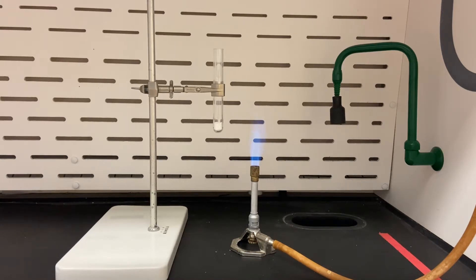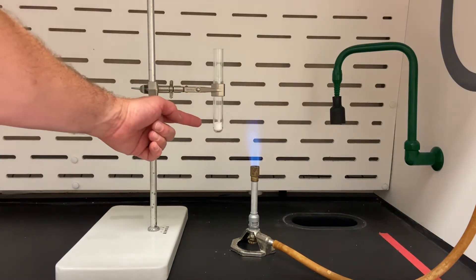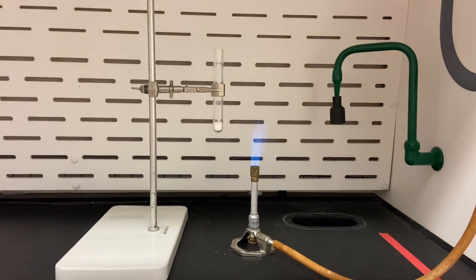So in this process what we're going to be doing is preparing some molten potassium chlorate. That's what I have here in the container in this ignition tube and then we're going to add our skittle to that molten potassium chlorate.